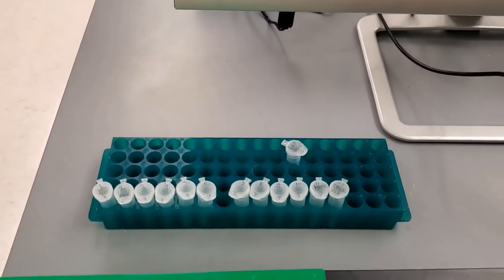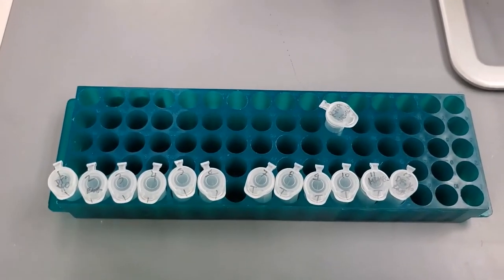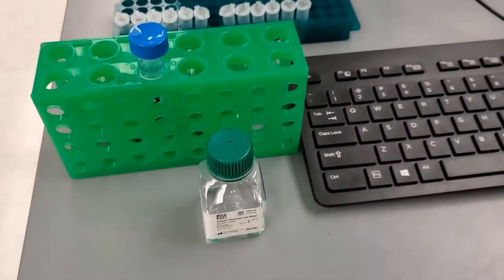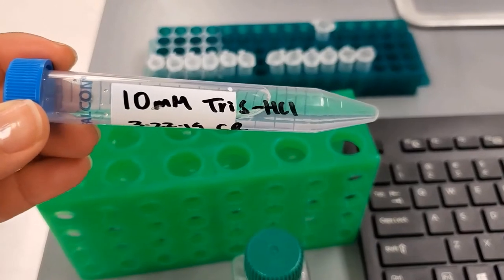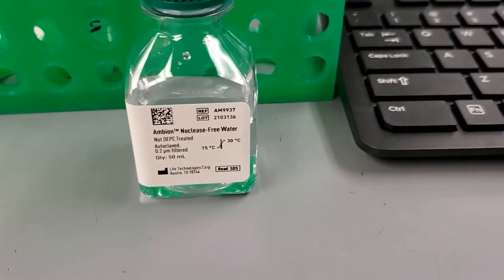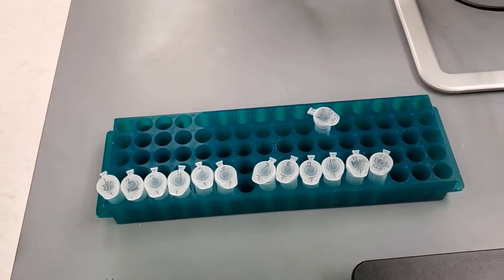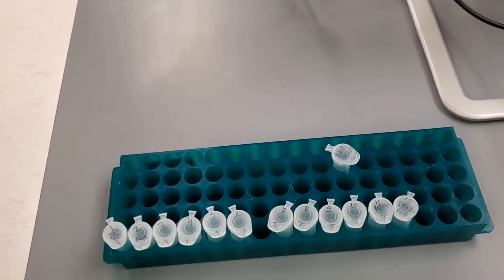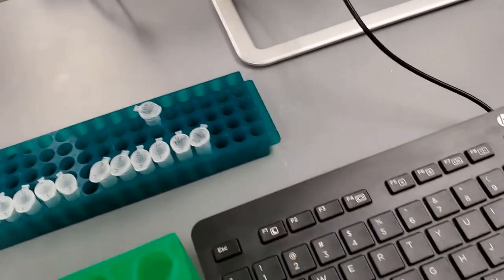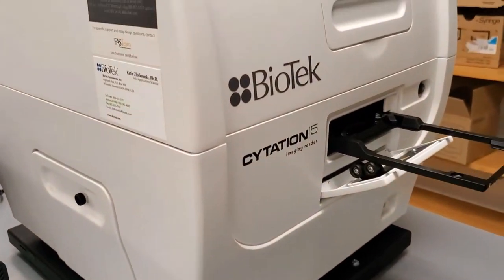The first thing I do before starting cDNA synthesis is measure the concentration of my RNA. I have my diluted RNA and blank sample ready. I use 10 millimolar Tris-HCl to dilute my RNA at a 1-to-10 dilution — though you can use water depending on what your lab does. I add 2 microliters of concentrated RNA into 18 microliters of 10 millimolar Tris-HCl, mix, and spin down.